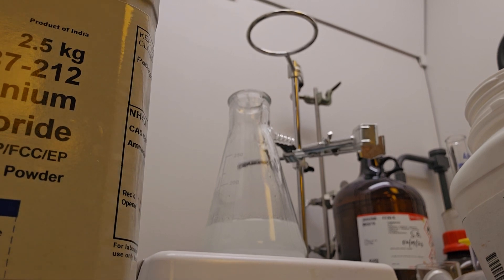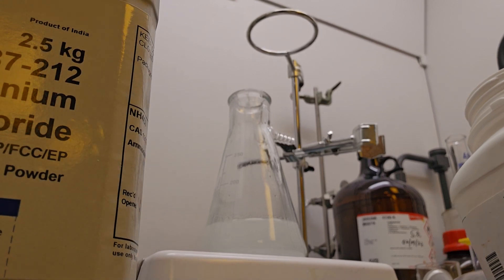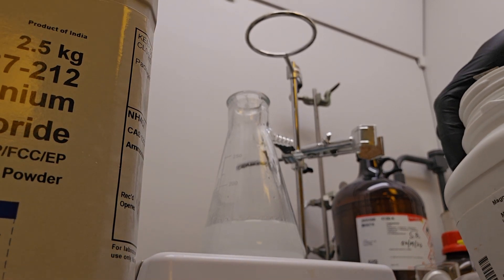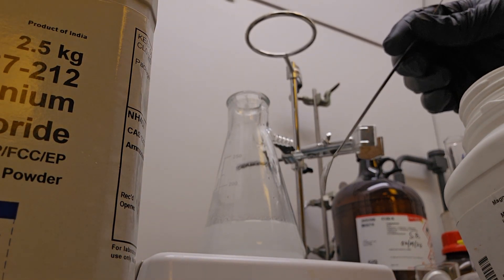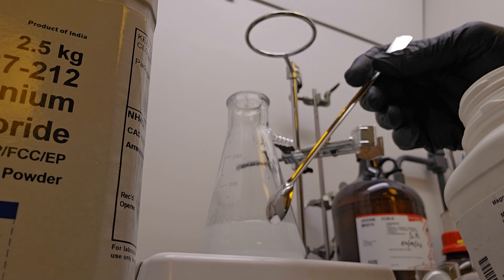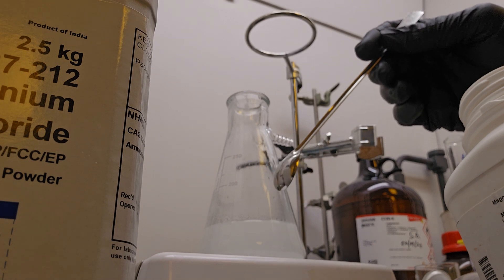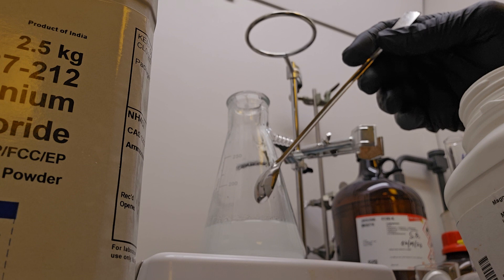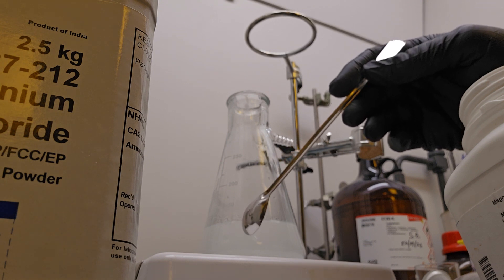Okay, we're back with another session. At this point we are cleaning, washing, and drying polyethylene glycol and dichloromethane solution.